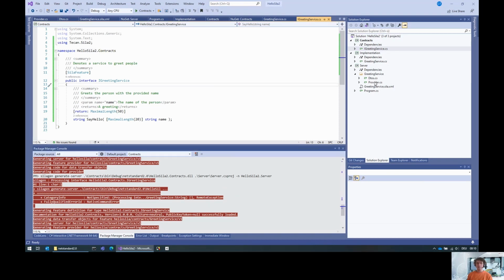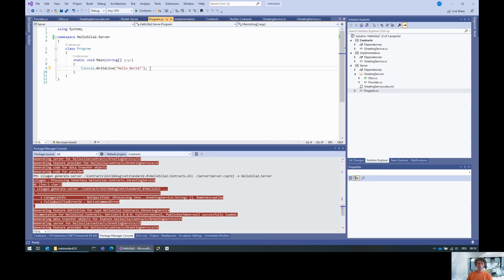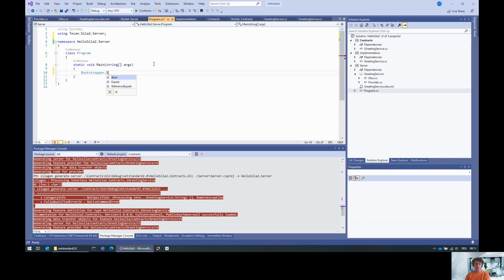Yeah, and then we are almost done. The only thing is we actually need to start the server. So currently our program just prints hello world to the console. And for this, the SDK contains an all-in-one solution for servers that is called the Bootstrapper. And we just use it to start the server. Now, the application would finish immediately afterwards, which is not what we want. What we want is to keep the server alive. And for this, we typically use a console read line, which means if you press enter, then you shut down the server. But as long as you don't do that, the server will be running.